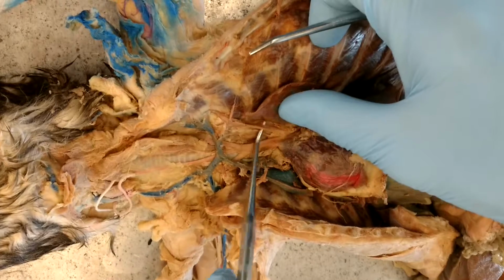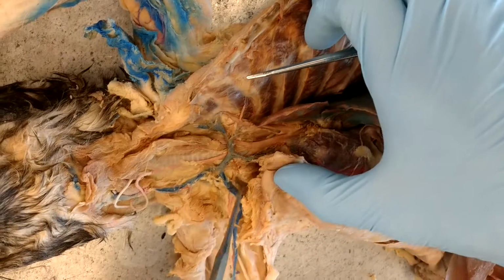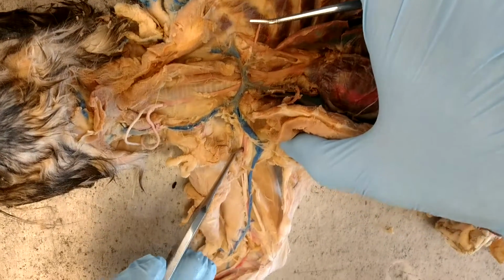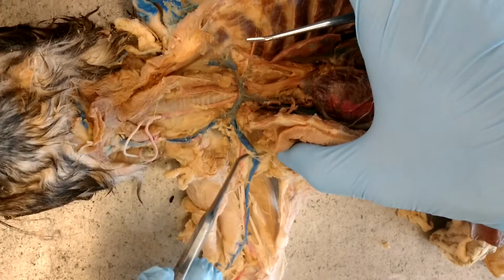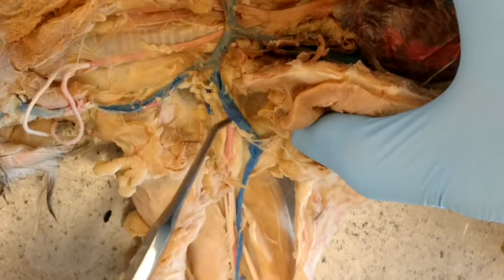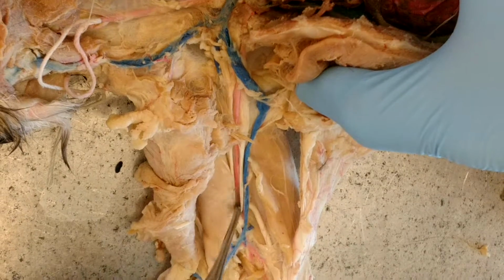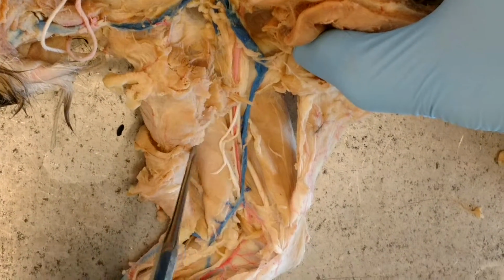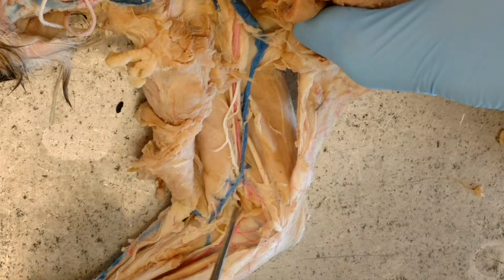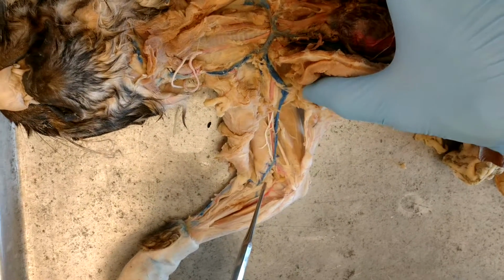Then, for the left subclavian, we go back off of the aorta here in the cat, just like in the human. Right? Let's follow the right subclavian here out into the armpit for the axillary. And you also have the vein there, right? So we have subclavian artery and vein. Then we have brachial artery in here between the nerves, right? And vein. And that's as far as I'm going in the cat. About your other instructor, I don't think we're going to have to go that far in the cat.